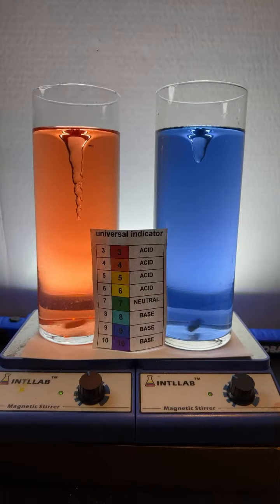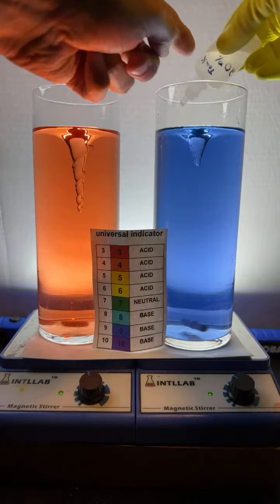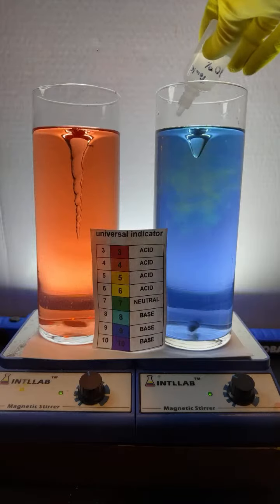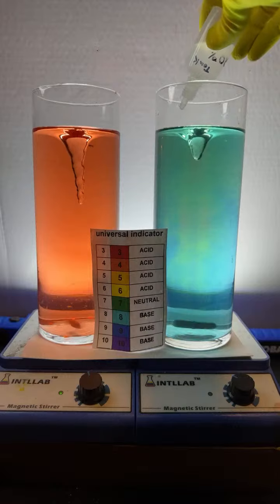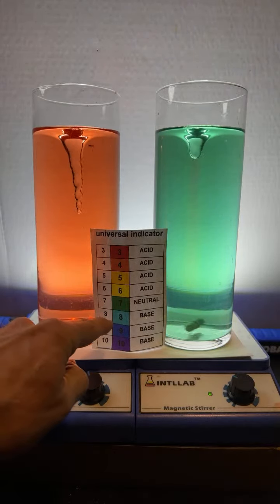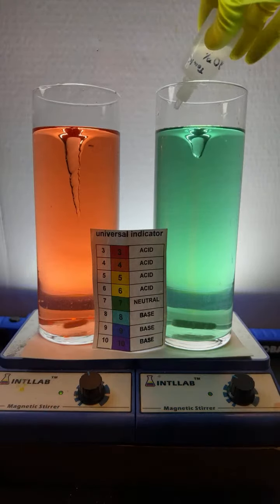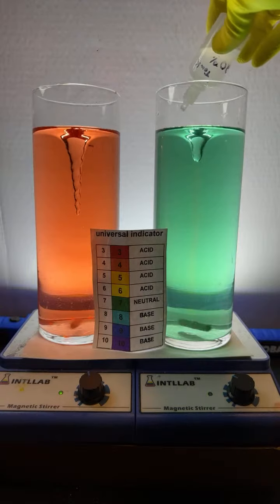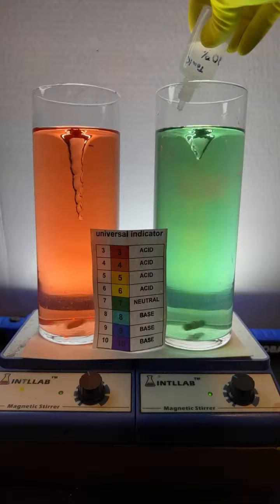And watch what happens over here on the left. Oh, we'll do it on the right. You can see up here at the right, I'm going to be adding some hydrochloric acid, the same acid that's found in your stomach. And when I add drops of that, you see the color shifted from a blue to kind of like a green. So you see addition of acid causes the pH to drop. And that's consistent with what we chemists know about pH. As the pH is lowered, the acidity increases.